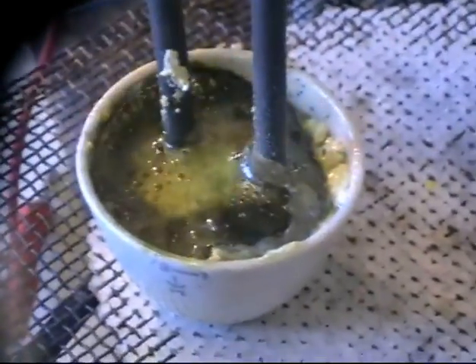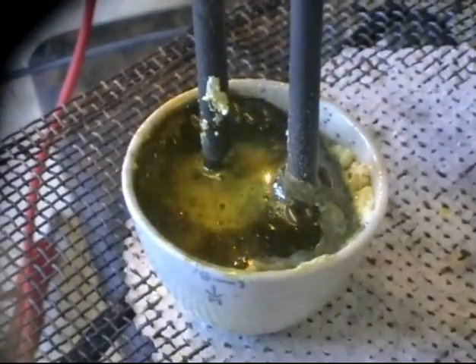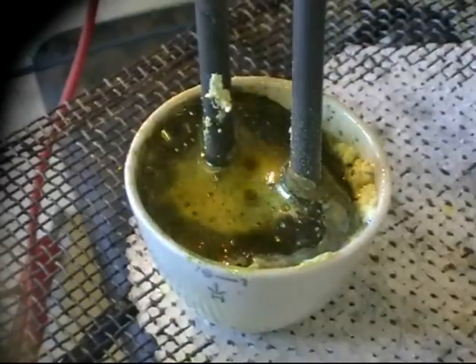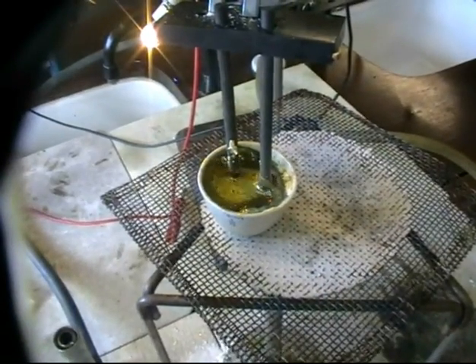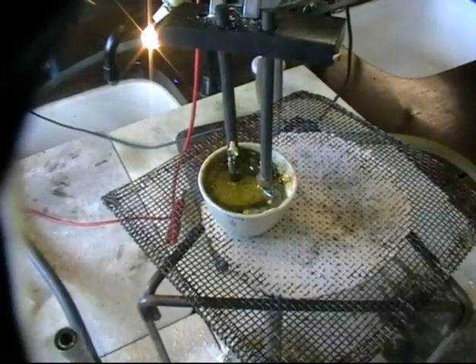The bromine gas is highly poisonous and will eventually bleach the paper. I'm going to pull back with the camera for a moment. I'm going to turn off the heat so that I can get in a little bit closer. If you pan out, you can see that the bulb is still on — I'm supplying electricity direct current using a power pack set at 9 volts.